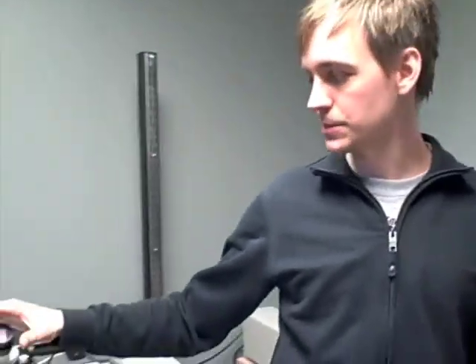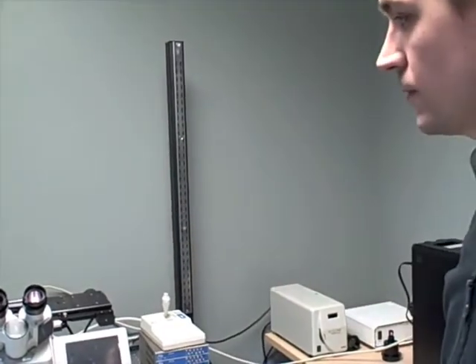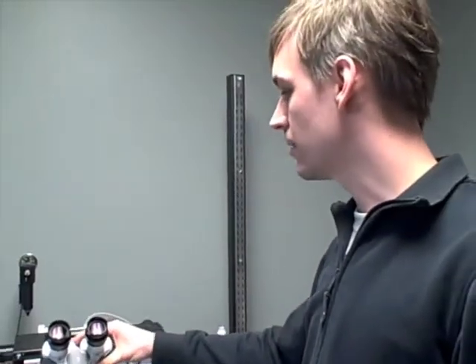Because it almost never happens anymore that you actually use the eyepieces to adjust, because your eyes just aren't as sensitive as the camera is, and a lot of times you're squinting to see something which, if you just put it on the computer, you can see very clearly. And so the eyepieces are almost there just to make it look like a microscope. Because if it didn't have eyepieces, it wouldn't look like a microscope, would it?